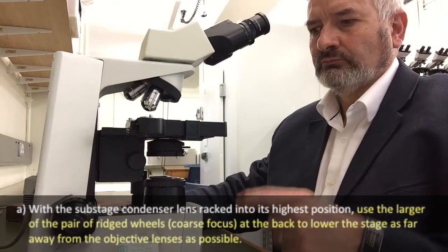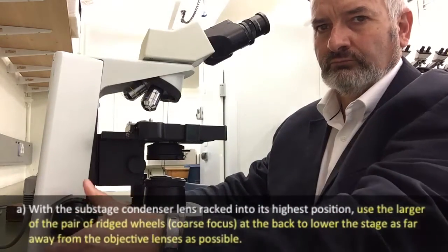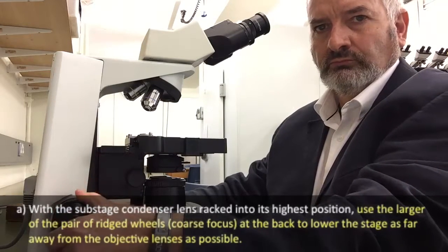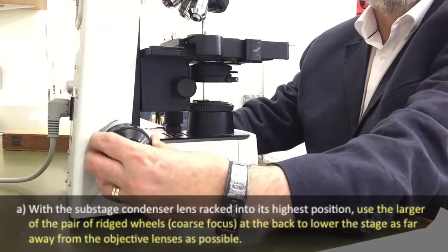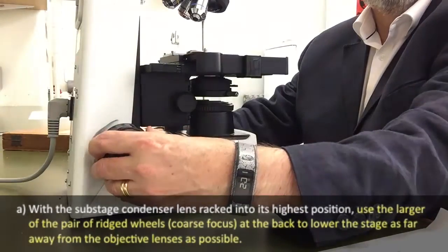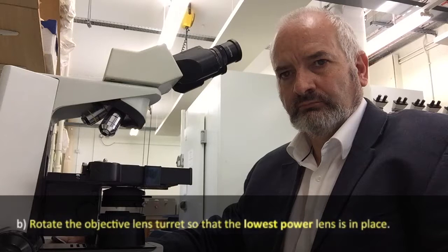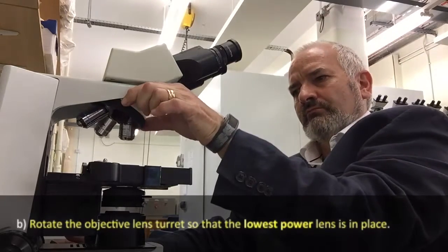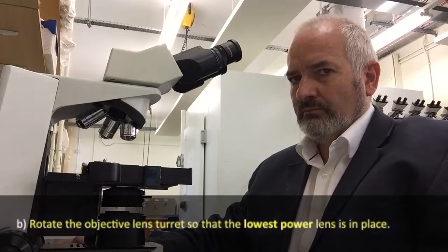Next, we use the larger of the ridged wheels — the coarse focus located at the back of the microscope — to lower the stage as far away from the objective lens as possible. The objective lens turret is then rotated so that the lowest power lens is in line above the specimen. In our case it's the four times objective, and that's the one with the red marking around the base.